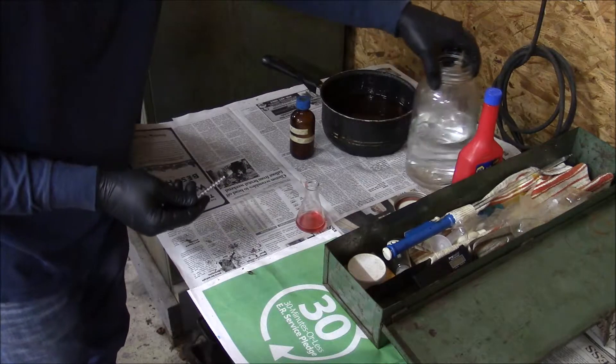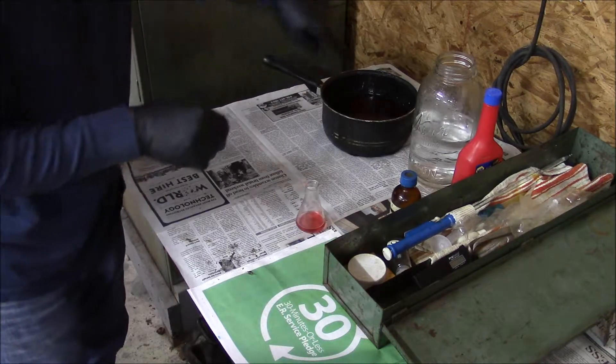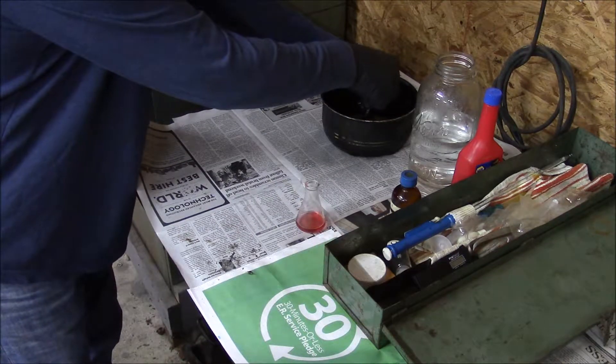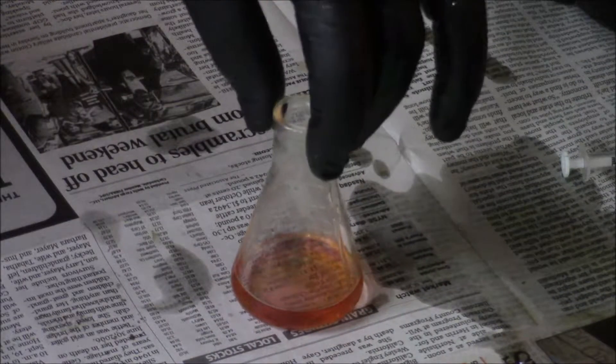I am going to take my oil sample and dip this down about halfway in. This is what I do — I'm not promising that this is the absolute correct way, but I have found success with this. I take my oil and drop it in my solution. This is going to change this solution into an acidic solution. As I swirl this, it will change it right back to yellow.